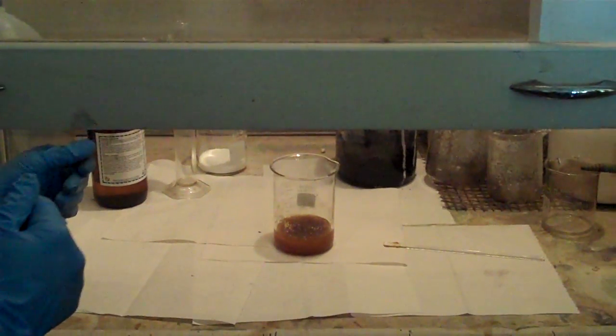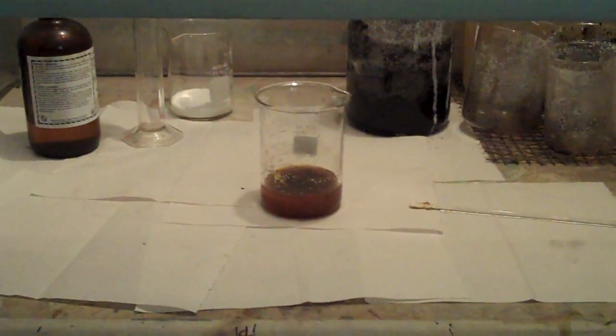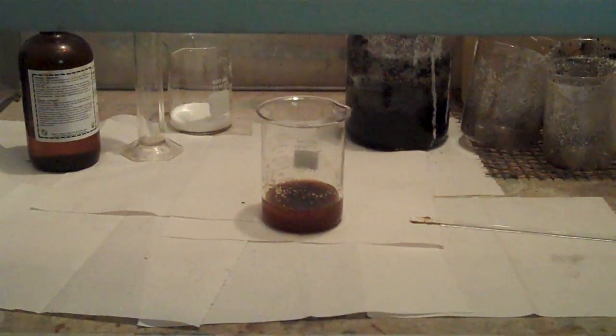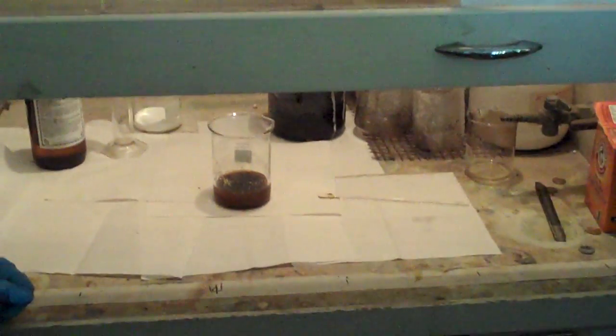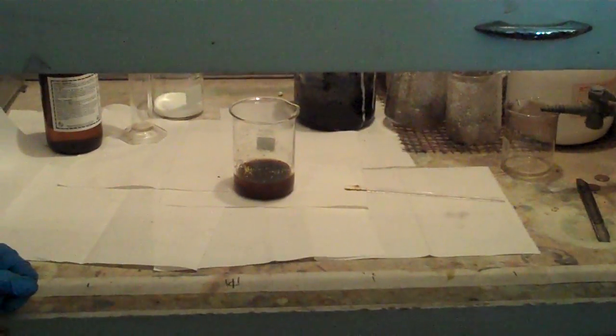Oh, so it's turning into a gas. Carbon? Carbon. If you think of graphite on your pencils, that's carbon. So it's not a gas. So is it going to layer the water on top of the carbon?